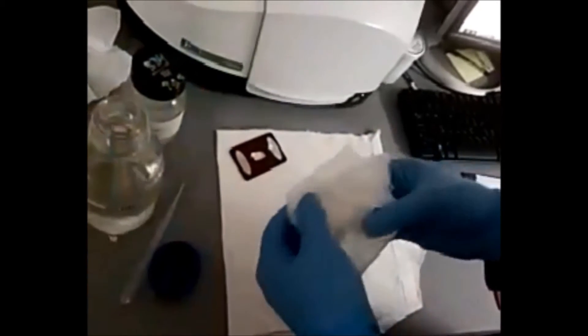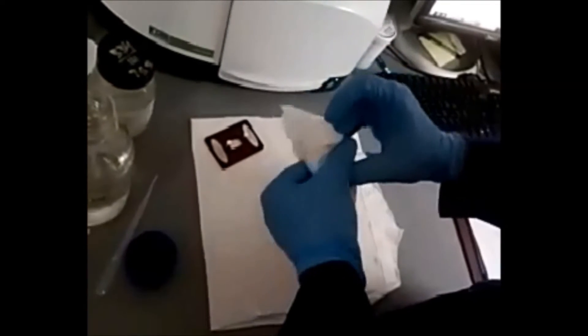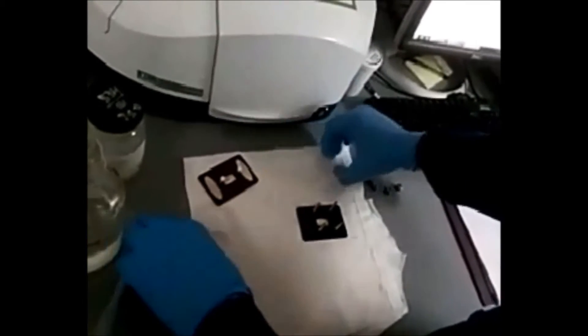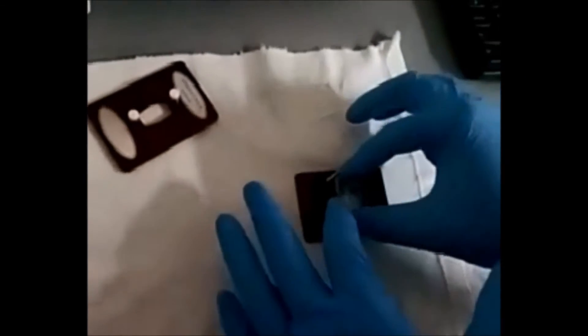So you take a few drops of Xylene, nothing too much, on a piece of tissue. There's normally other things that you can use to clean as well, but this is quite convenient, and you will have these in your lab. So just rub it in. Take both the slides. Make sure you don't drop them, because these slides are expensive and sensitive. So here I have them. These are all cleaned up, and they will now be used for the FTIR.